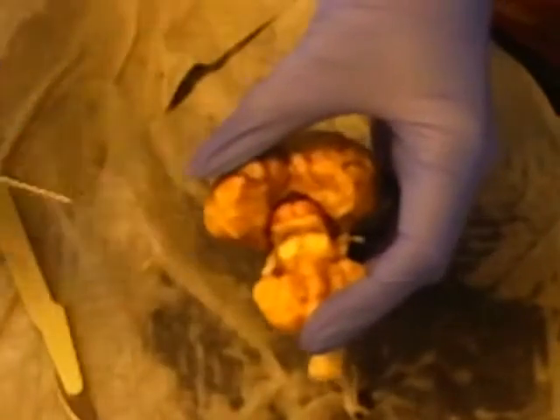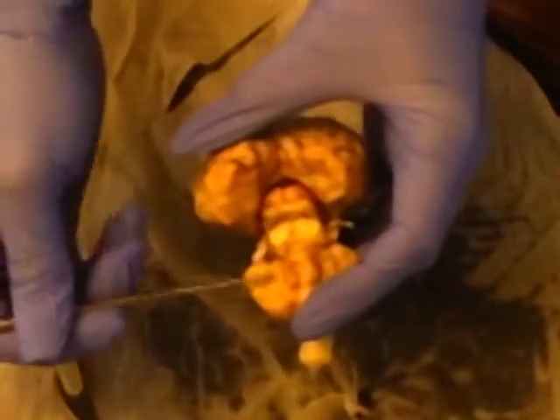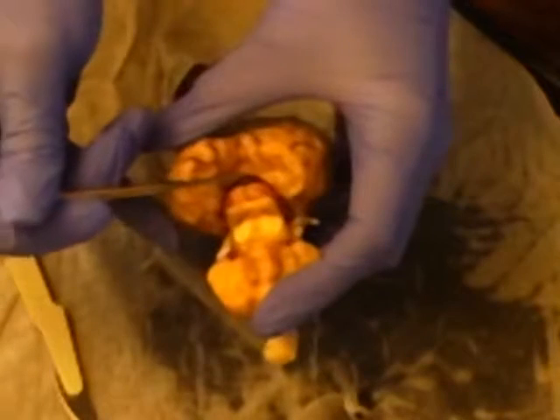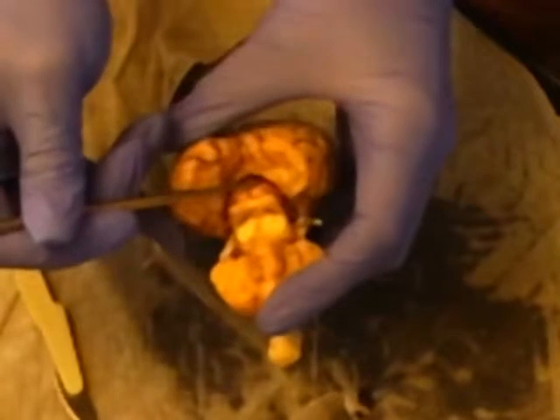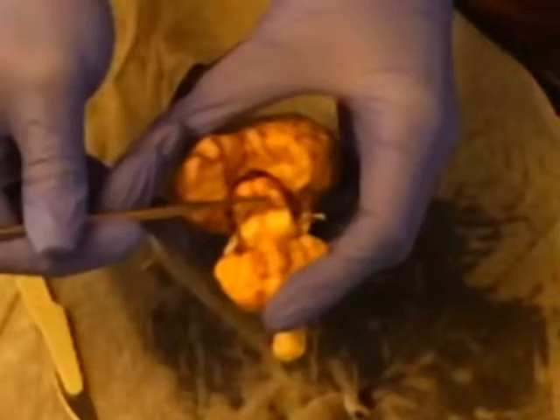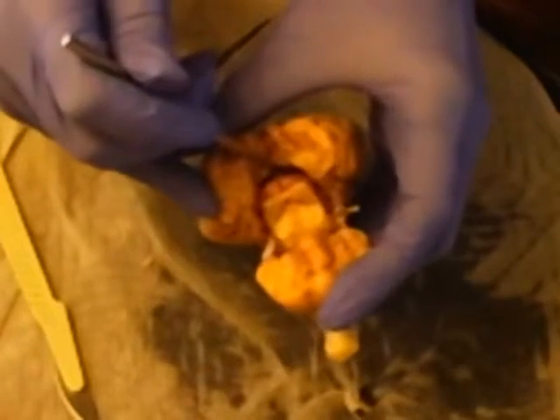In viewing the midbrain, we separated the two hemispheres of the cerebral cortex and also the occipital region. So this is the corpora quadrigemina right here. And then you have the superior and inferior colliculi. And inside right there is the pineal body.